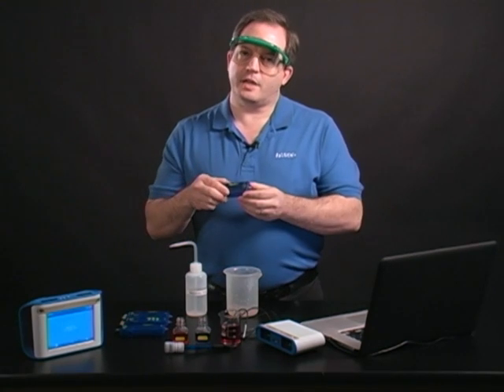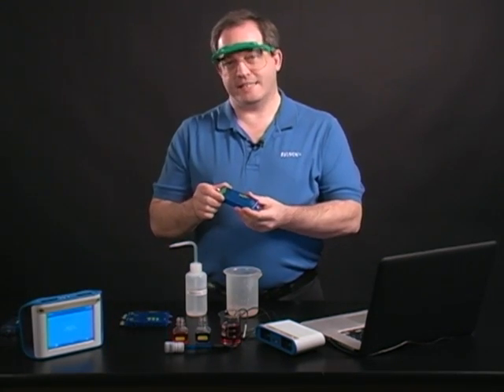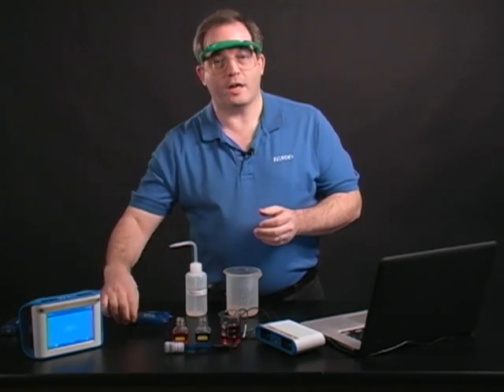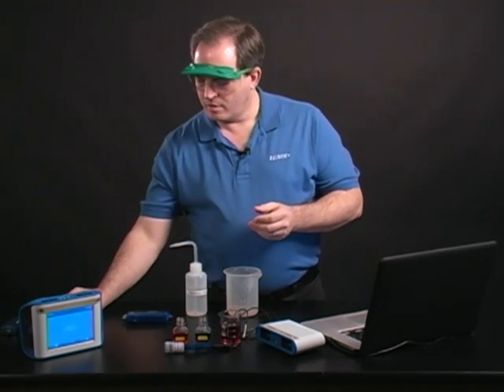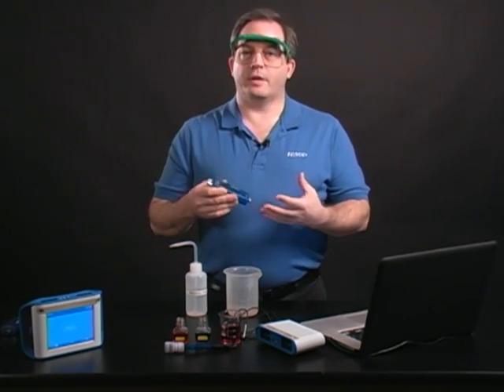Whether you are using a pH sensor, a pH ORP-ISE sensor, a water quality sensor, or the chemistry sensor, you're going to be using the same procedure to calibrate for pH.